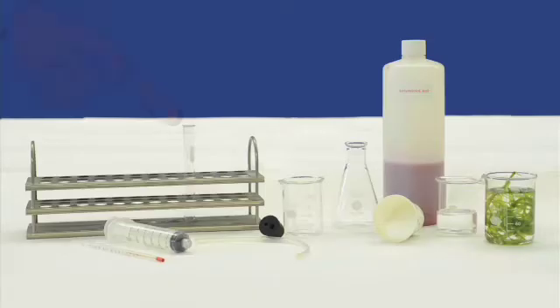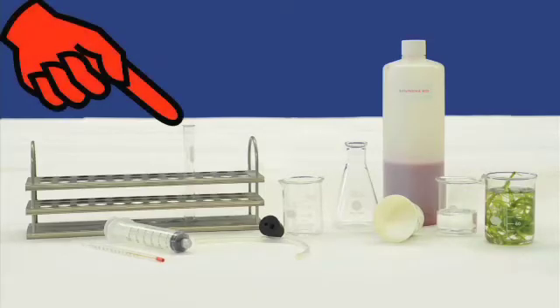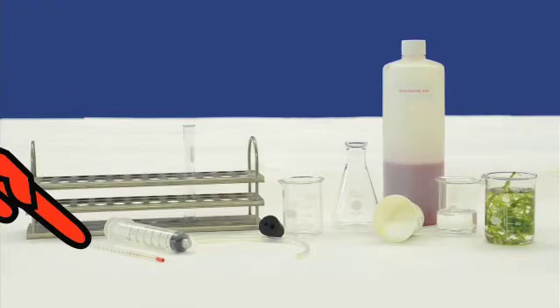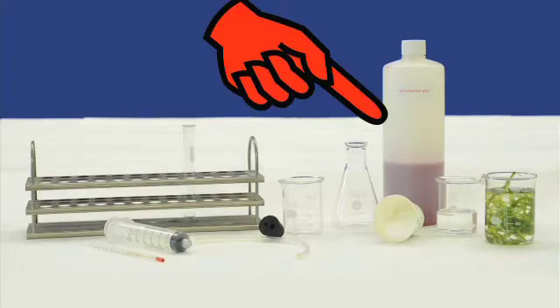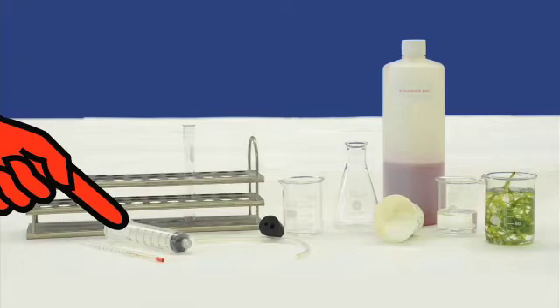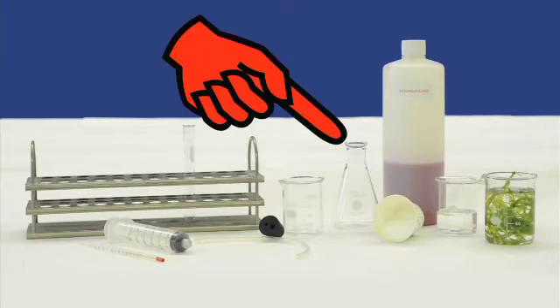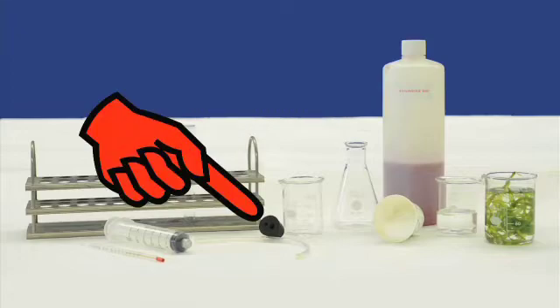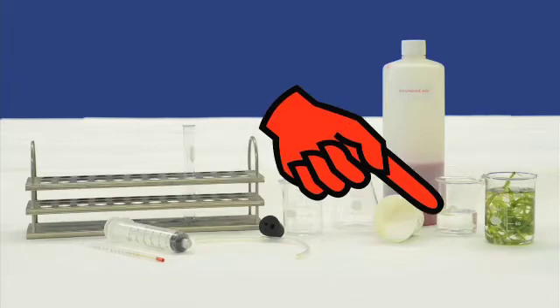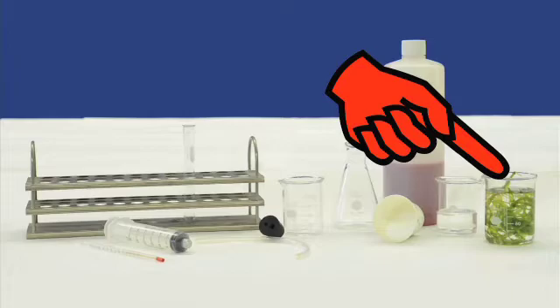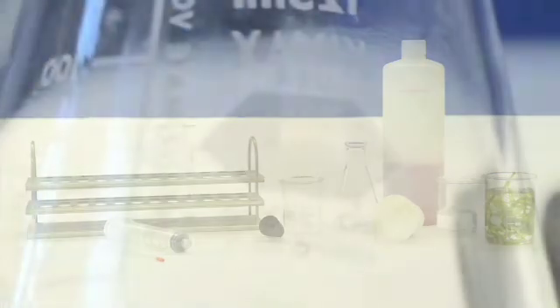The materials you need to have are one nine milliliter glass test tube, one test tube rack, one red liquid thermometer, one 100 milliliter graduated beaker, diluted phenol red, one 30 milliliter syringe, one 125 milliliter Erlenmeyer flask, one two-hole rubber stopper, one piece of plastic tubing, one tablespoon of baking soda, 30 milliliters of vinegar, and one 3-inch Anacharis sprig.